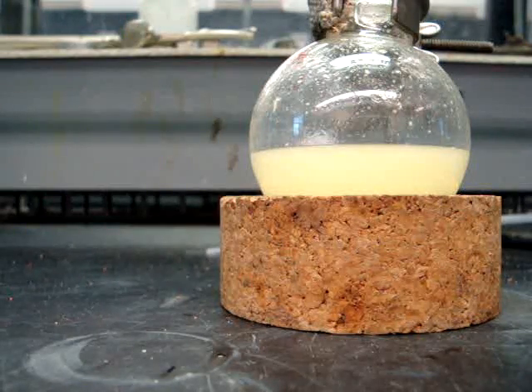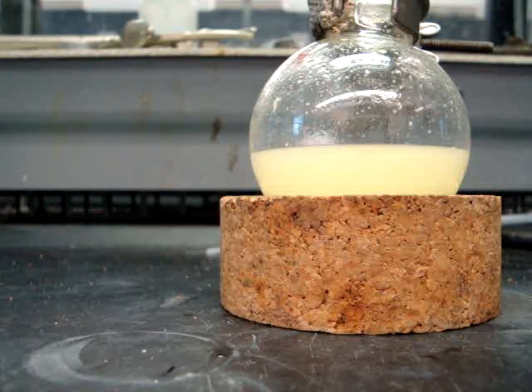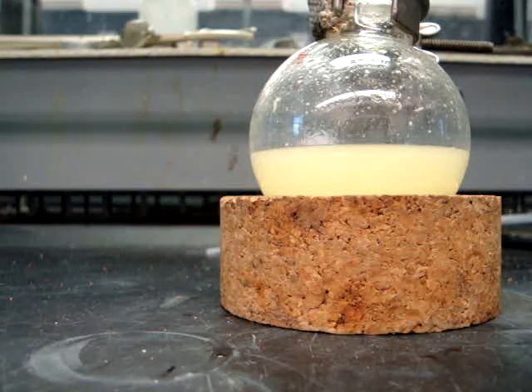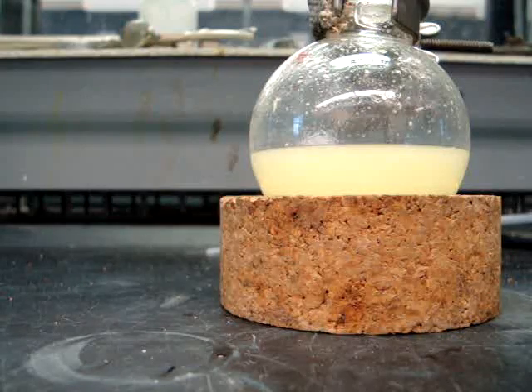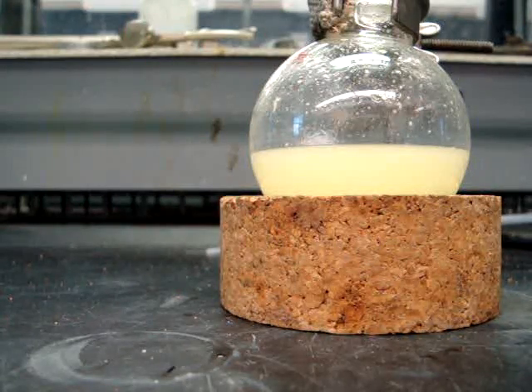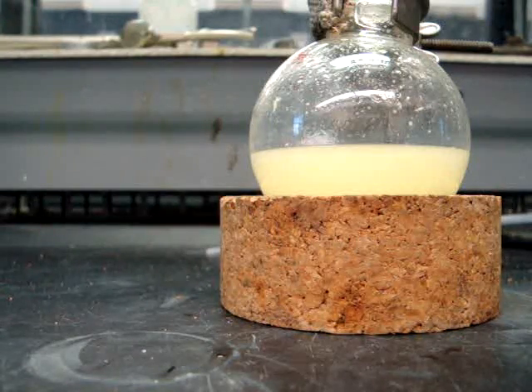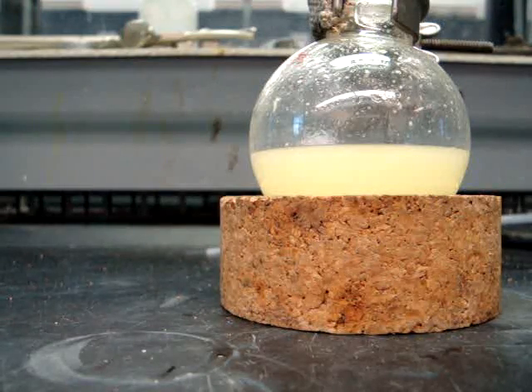Once your product has been recrystallized, if you do not see crystals, you will need to scratch the inside of your flask again to initiate crystallization. Once again, you will collect the products on the Büchner funnel. This time, you will wash the crystals once with about three milliliters of ice-cold 70% ethanol. Dry the products under vacuum filtration by attaching the tube to an aspirator for about 20 minutes.